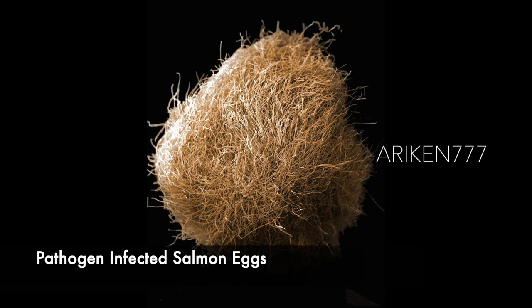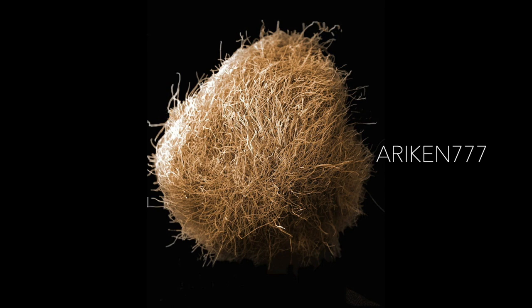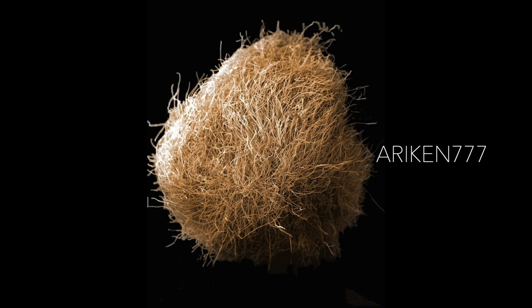This is a salmon egg infected with Saprolegnia parasitica. The fungus causes saprolegniosis, or water mold disease, which affects wild and cultured freshwater fish and fish eggs worldwide. The disease is characterized by abundant mycelial growth on the egg's surface, first established on dead eggs and then extending to neighboring healthy eggs. In fish, the fungus invades the skin of the head or fins, with subsequent spread over the entire body.